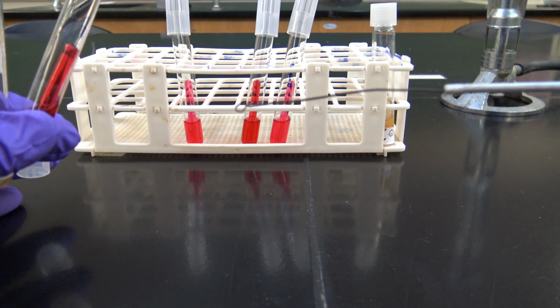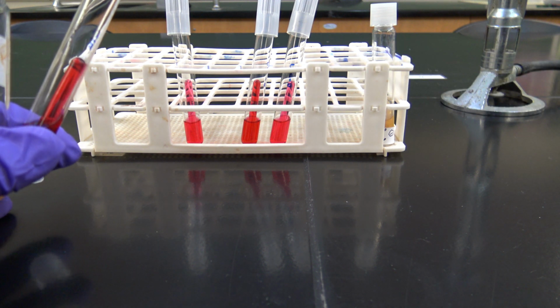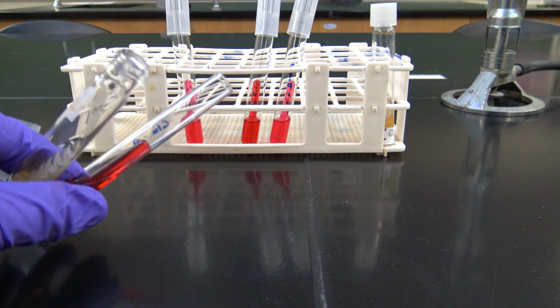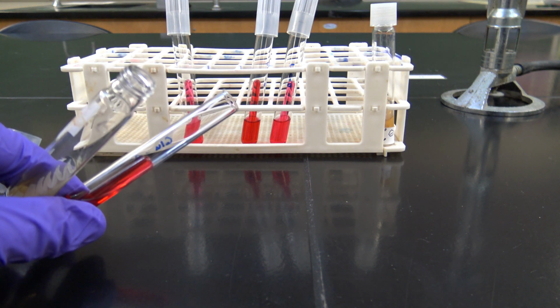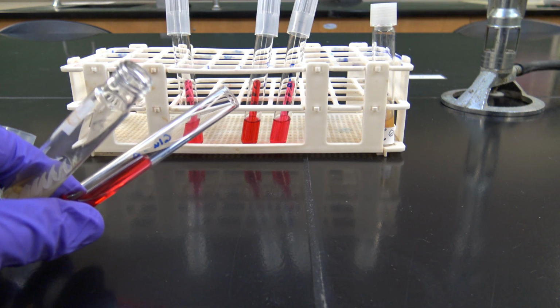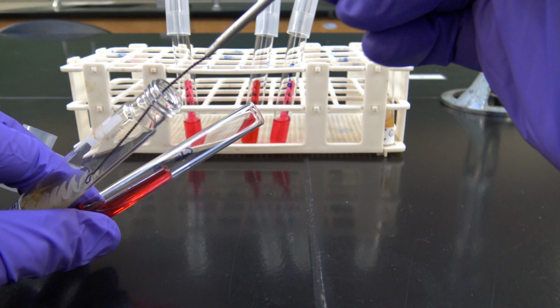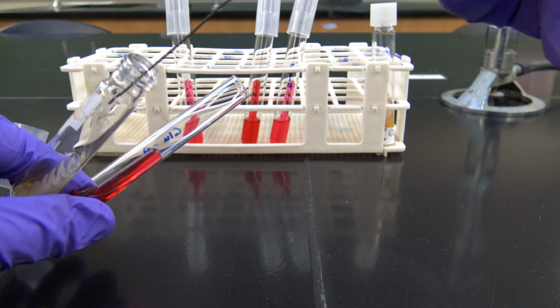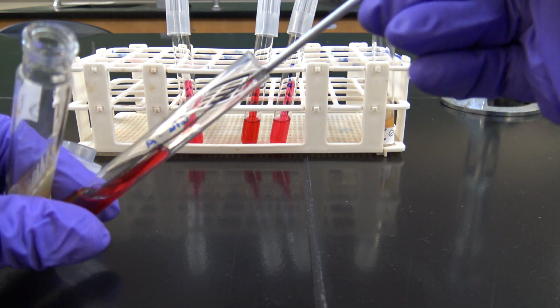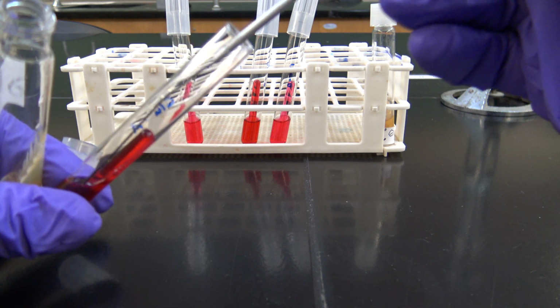My loop has avoided touching anything, so it is sterile, and it's ready to go into my slant and pick up some cells. So remember, with bacteria, you don't need a lot. So I don't need to go in here and dig up a big chunk of culture there. I just need to go in here and just touch my top streak there that I have a little bit, and then put it into my sterile phenol red broth tube. I'm just going to spin it around a little bit gently because I don't want to force any bubbles into my Durham tube.